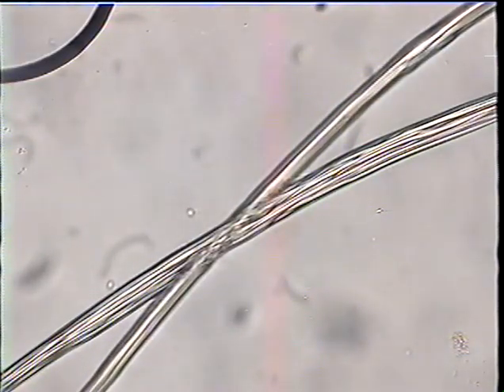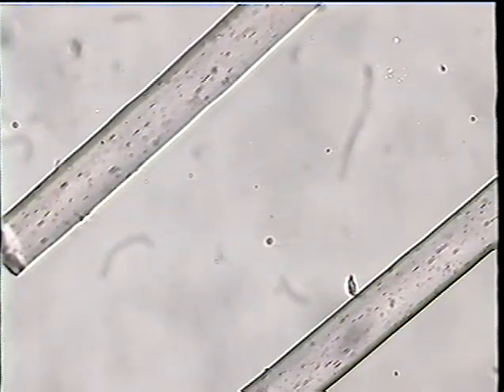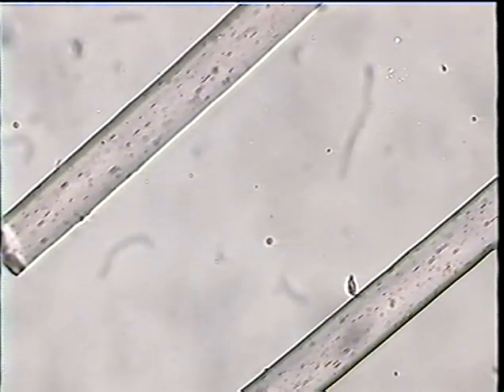These are synthetic fibers, viscose rayon fibers. They have longitudinal striations, and that characteristic cross-section helps to tell me immediately that they are viscose rayon. All synthetic fibers have characteristic cross-sections. These are nylon fibers, perfect cylinders. They are smooth-walled, they're clear. These particular ones are colorless. They could be dyed, of course.